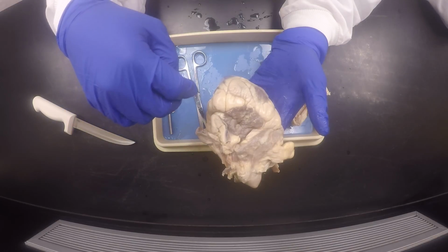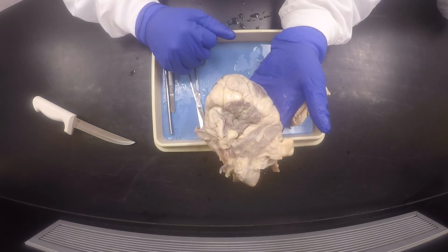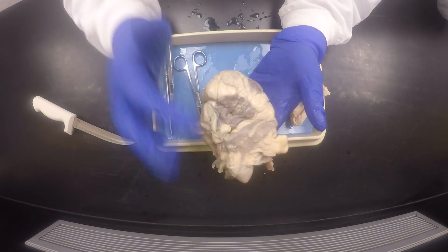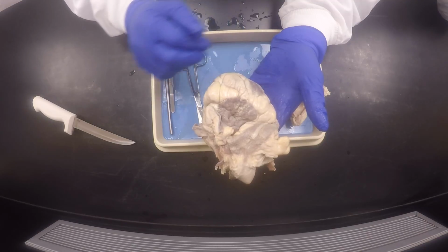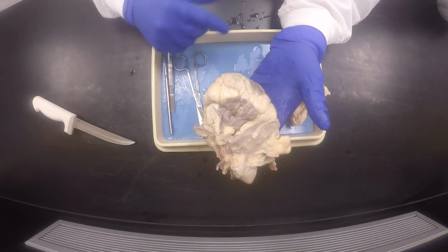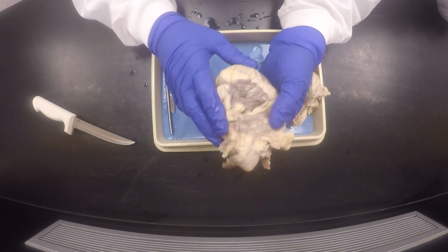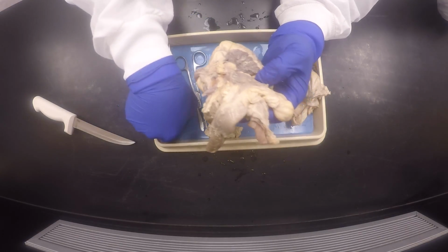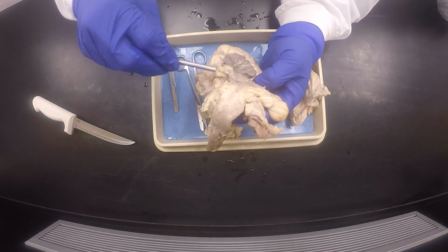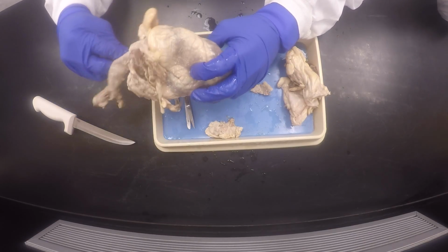interventricular groove, interventricular sulcus, you will see a major blood vessel right in front there. You'll see it, and that is the pulmonary trunk. It's going to the lungs. It's going to split into the left pulmonary artery and right pulmonary artery. So that's why we call it a trunk, pulmonary trunk. It's an artery. That's one of the four major blood vessels into and out of the heart.